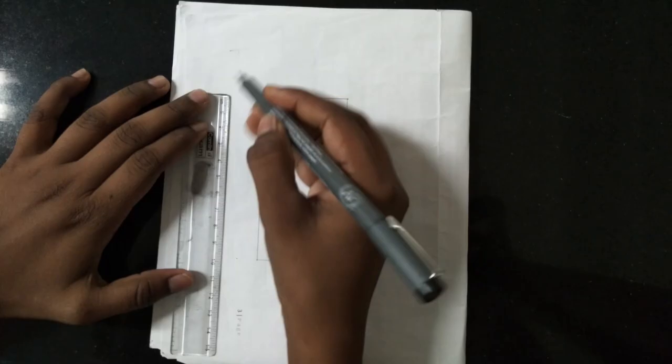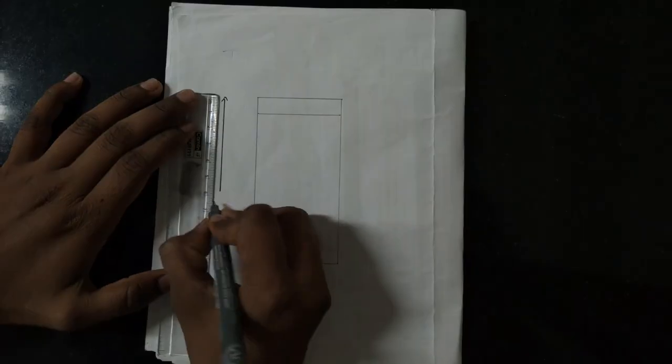Is there any technique for cutting the plate? Yes, there is a technique for cutting the plate. The plate which we will be using for this experiment is cut in the dimensions of 5 by 10 cm.